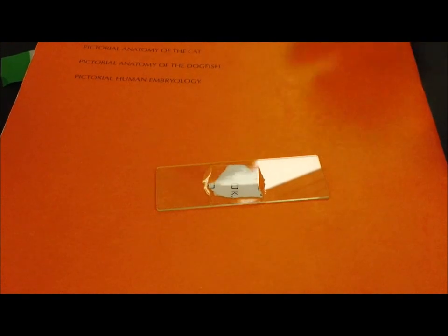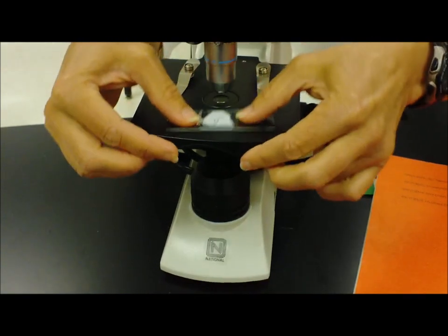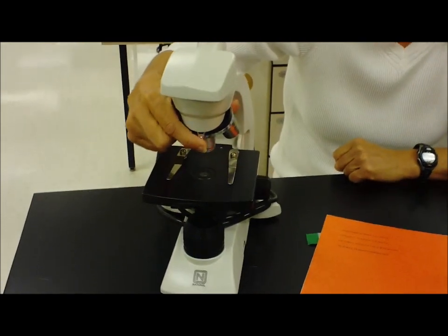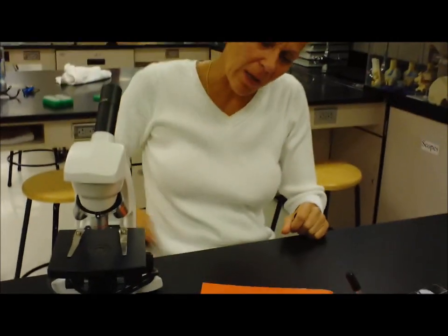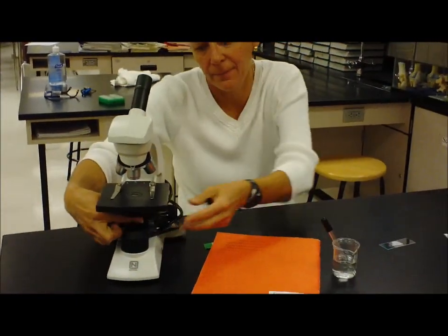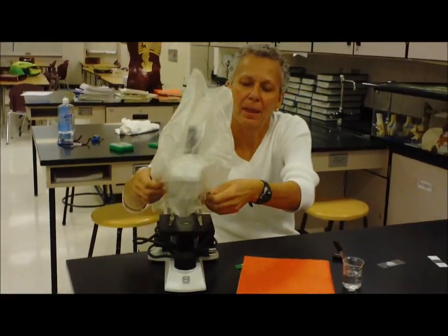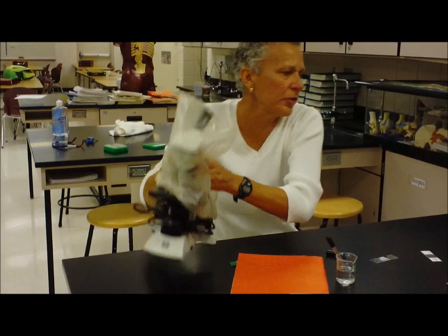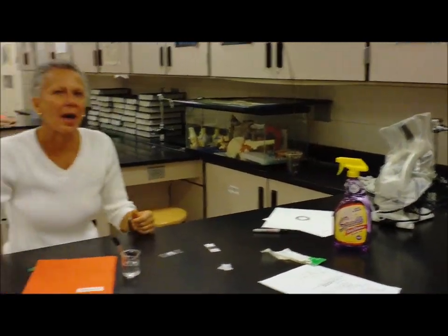The last thing we need to talk about is cleaning up. So when I'm done cleaning up, I will remove my slide, change the lens back to the scanning lens, pull out the plug using my hand at the plug and not on the cord, replace the cover, and then we're just going to often store these in the middle on the table so that they don't get knocked off.